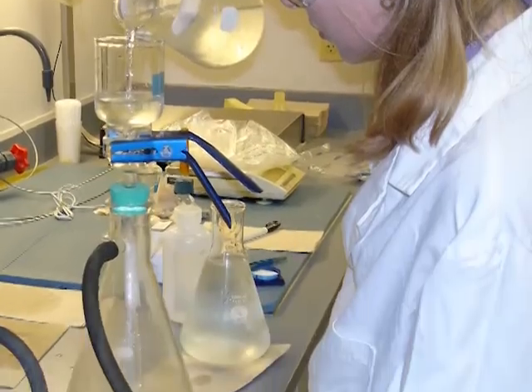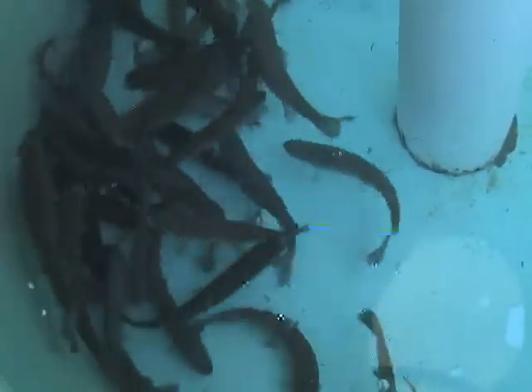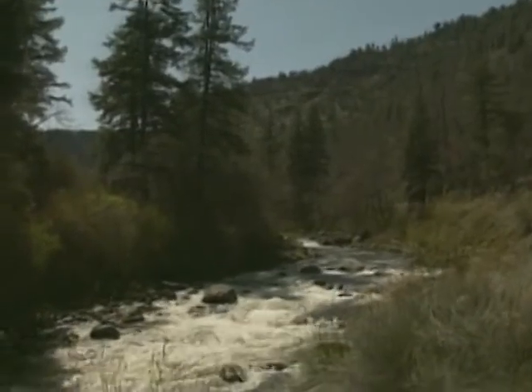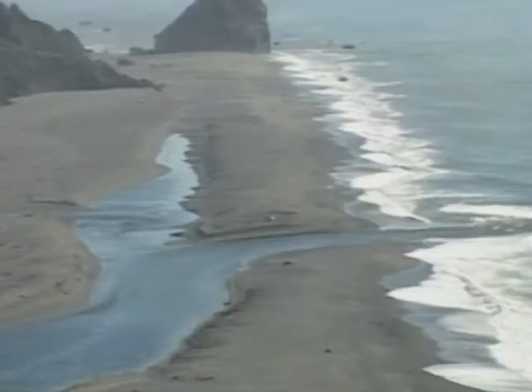qPCR led to an important new discovery for the Bartholomew lab. When qPCR was first tested in 2004, we systematically placed sentinel fish, in this case susceptible out-of-basin rainbow trout, in the water, and also collected water samples. And we did this up and down the Klamath River, taking 19 paired samples from the Williamson River all the way down to Hunter Creek near the estuary. And generally, wherever we detected the parasite in water by qPCR, fish became infected. However, we were surprised that qPCR values did not directly correlate with infection severity in fish.